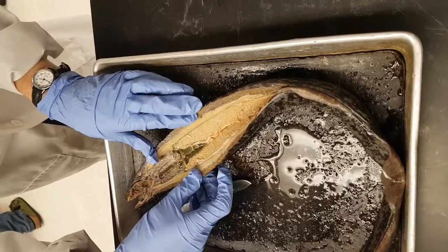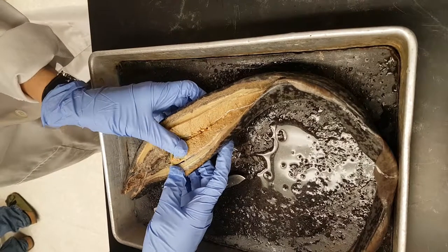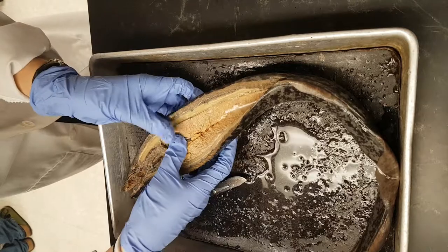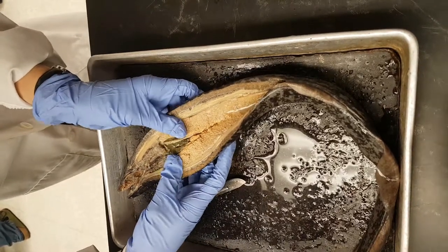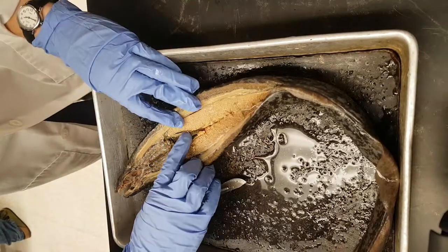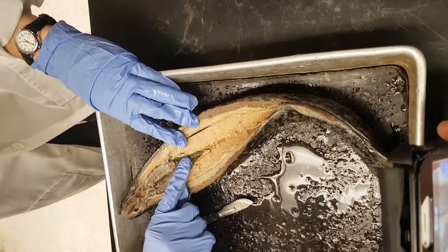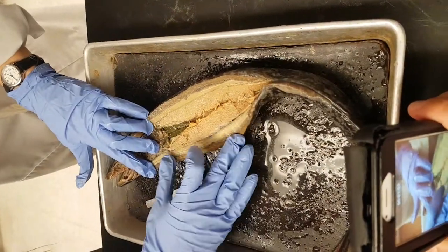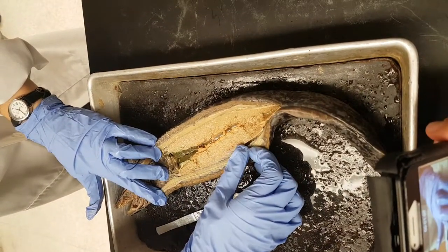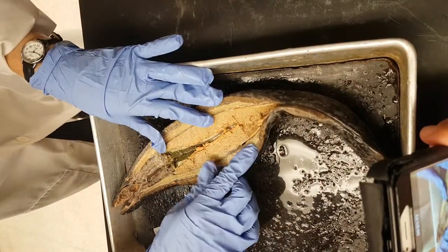Your intestine is going to be right here — I think I also cut right through that. So it's here, this line, dorsal to... This is kidney, right here. This is a female, because you have your ovaries that have all of your eggs in them. You can tell because the eggs are literally right here.